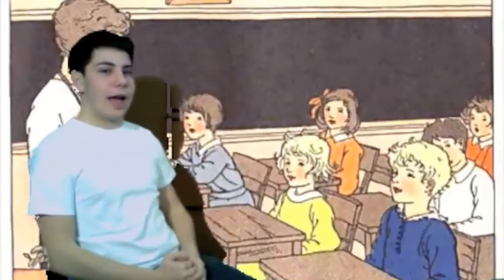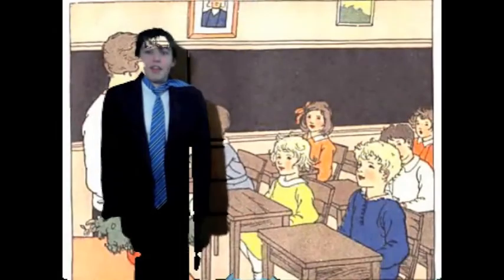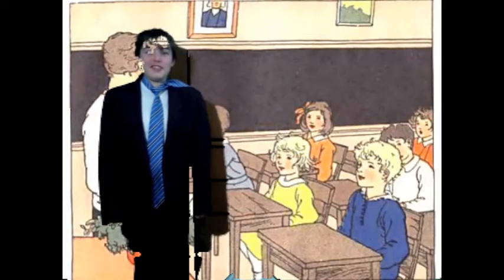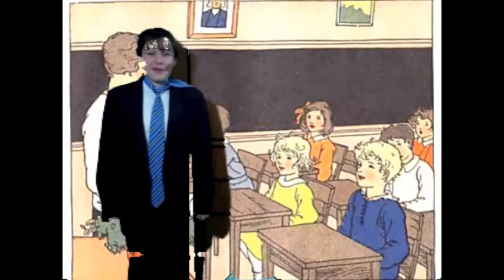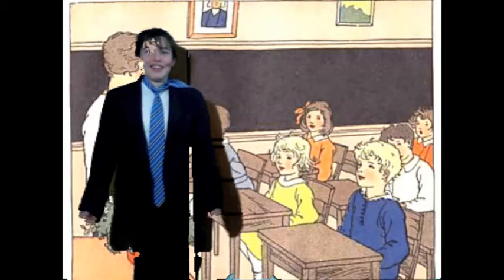Wait, Ms. Rizel, how do we study microbial succession? The best way to study microbial succession is through a Winogradsky column, and that's where we're going today — inside a Winogradsky column.